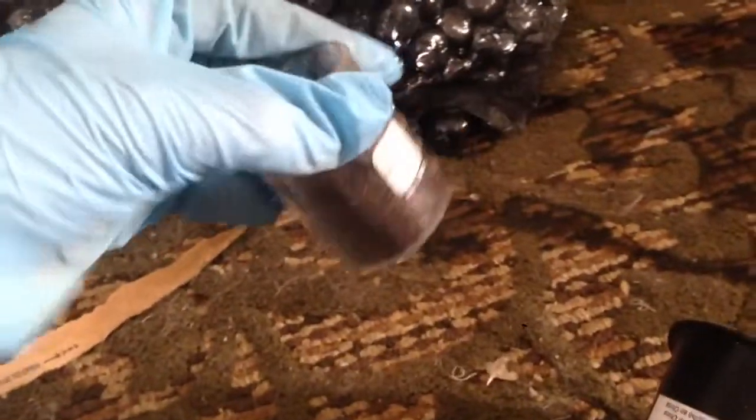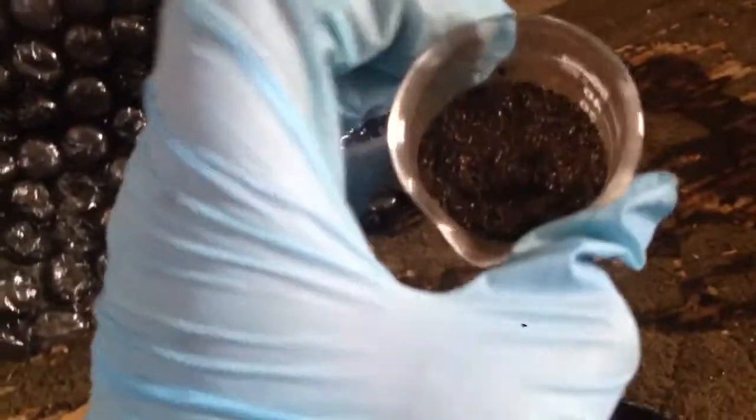You'll be able to see quite a lot of iron is picked up. I simply pulled that up and all the stuff comes off in the end. Here is our iron powder — but I'm not done yet. After the magnet, you have made some rather impure iron powder.